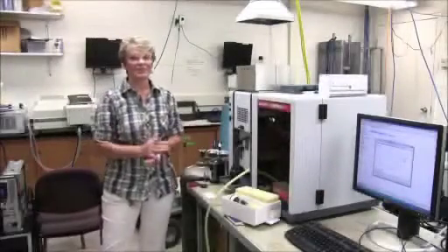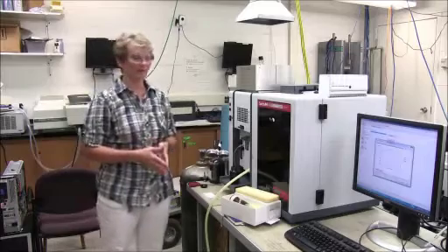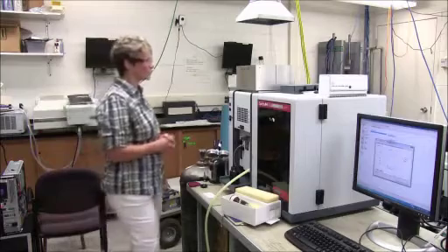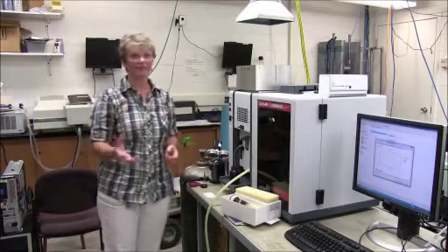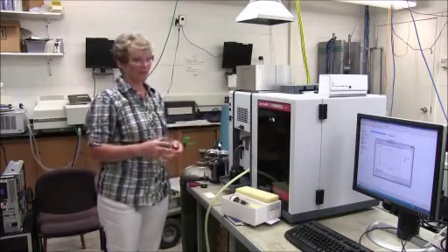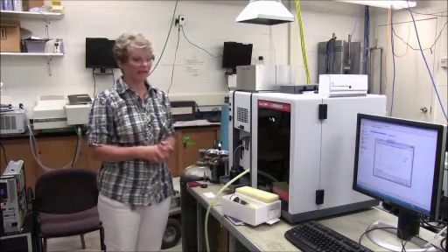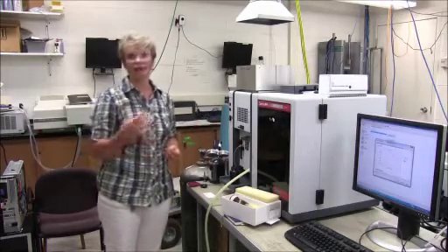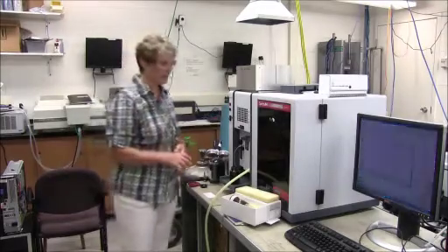Welcome to McMaster University's Chemistry Department, and we're standing here in front of the Atomic Absorption Spectrophotometer. An Atomic Absorption Spectrophotometer, or AA as we shorten it down to, is used for looking at certain amounts of trace elements in samples. And these can be environmental samples, or it could be the lead in paint that's used on a toy that you want to detect, or it could be a chemical sample that you've added a metal to and you're looking to see whether it was taken up in a tissue or whatever.